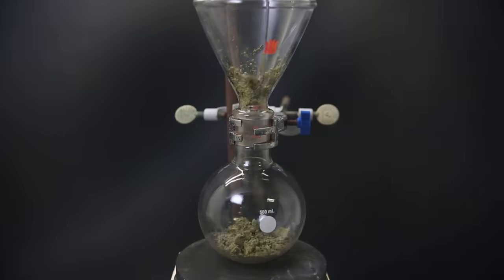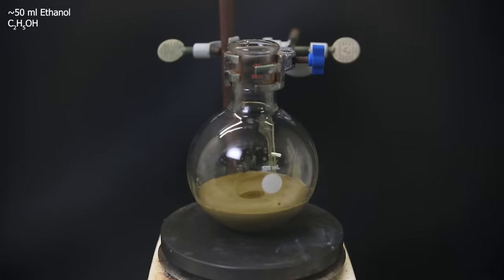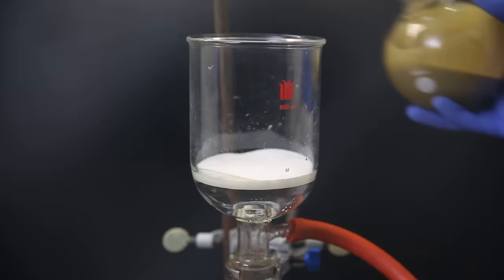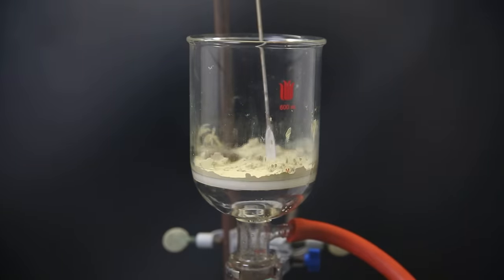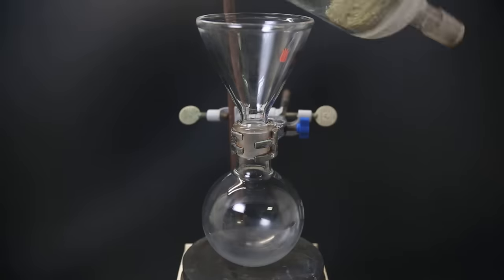The product has a dirty brown-green color, so it has to be cleaned. So I move it all to a flask and let it stir in ethanol for an hour to dissolve most of the impurities. I then filter through a glass frit again and wash it with some more ethanol. The color has become a lot better, so I will use it like this for the next step.